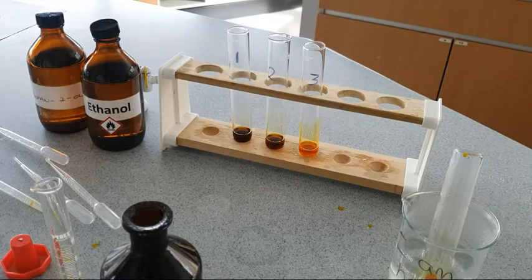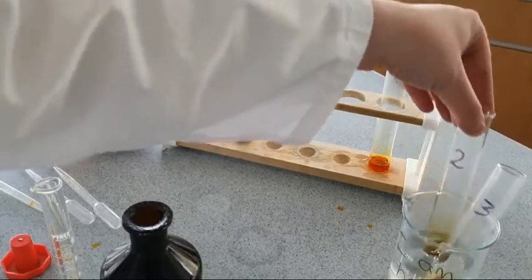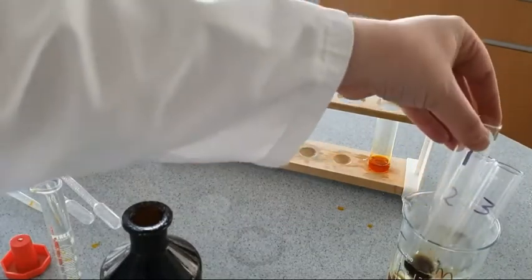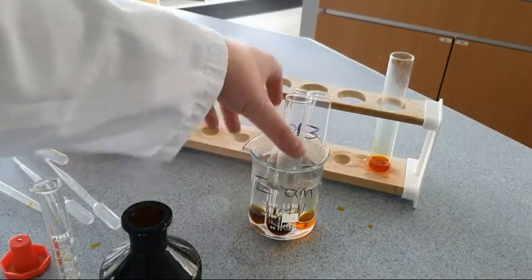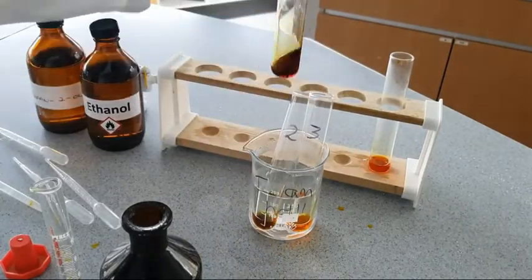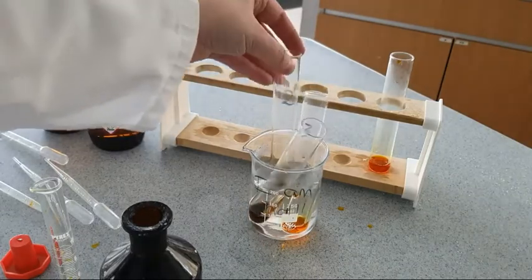So you can see in test tubes 1 and 2 the colour is changing, whereas in test tube 3 the solution is remaining orange. So in test tubes 1 and 2 we're getting oxidation, and in test tube 3 we are not seeing anything happen. If we give them a little bit of a warm, then perhaps we'll be able to speed up the reaction, get the reaction happening quicker. Let's see if we can see the result of that oxidation occurring.